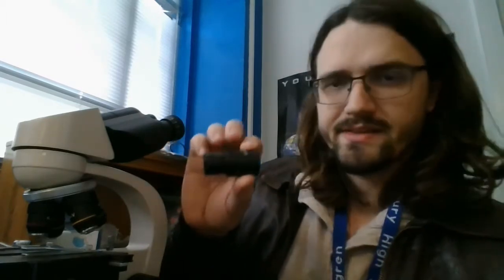When we're talking about the total magnification of a microscope, this is the eyepiece. This actually magnifies things by a factor of 10. So just looking at something through this eyepiece will magnify it so it's 10 times larger than it was previously, and usually that's marked with something like a 10x symbol.